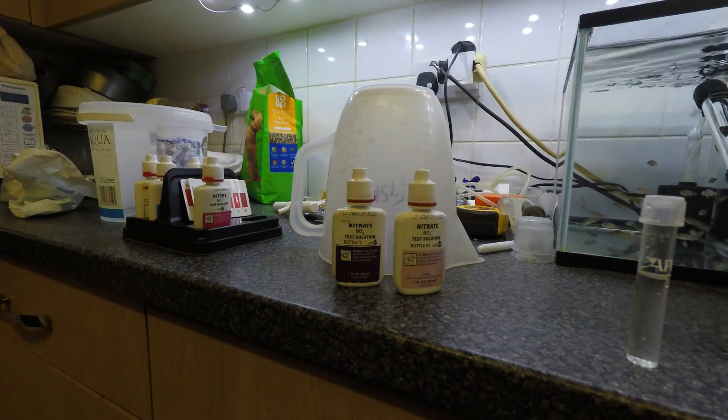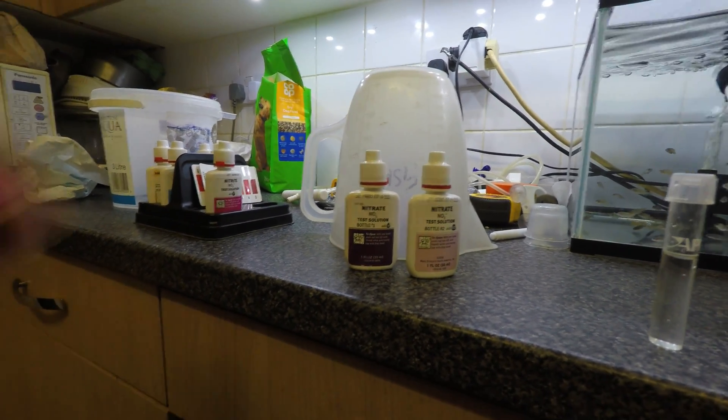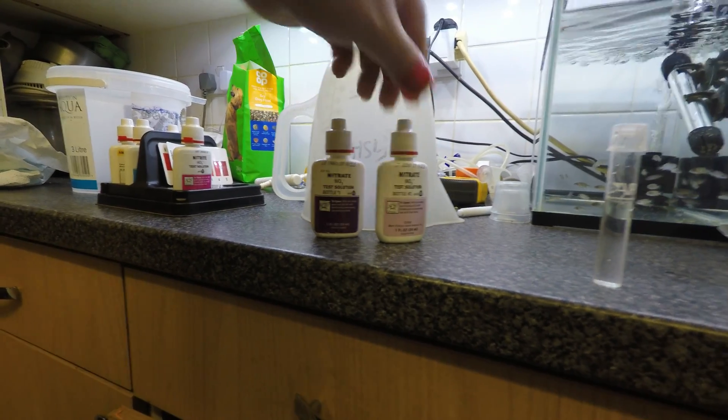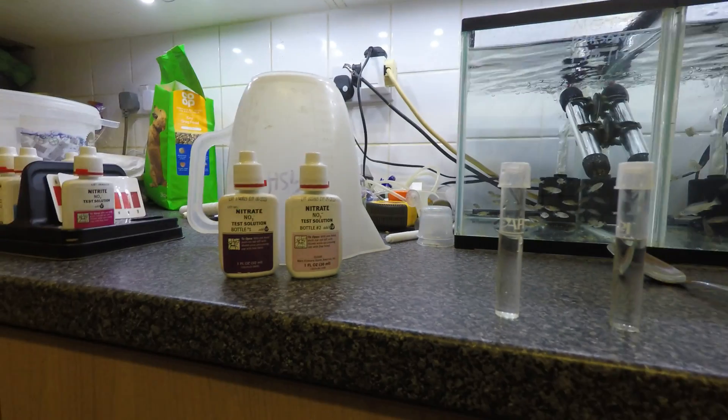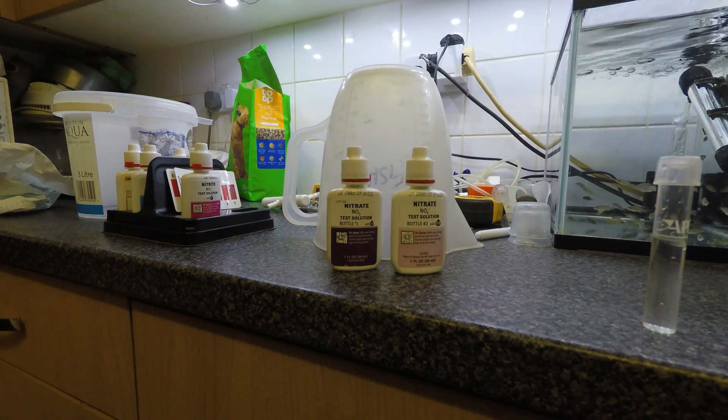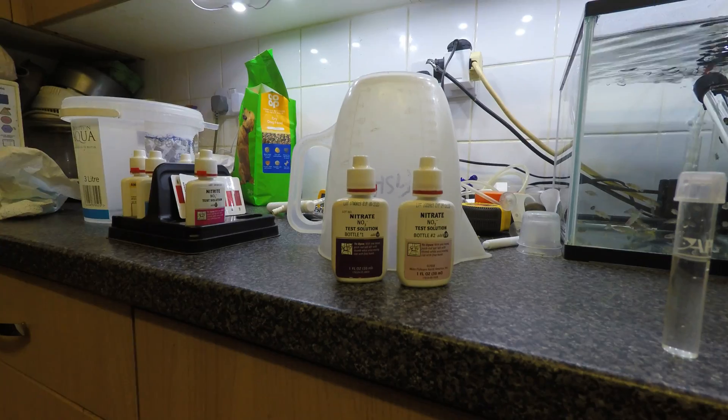For the test I'll be using the API nitrate test. There's the two vials. I will now add the drops and we'll give it five minutes for the color.